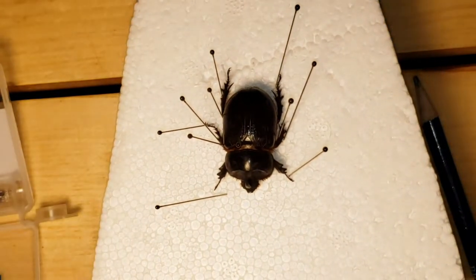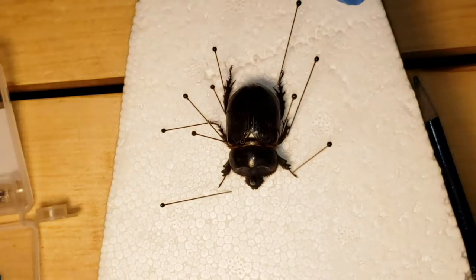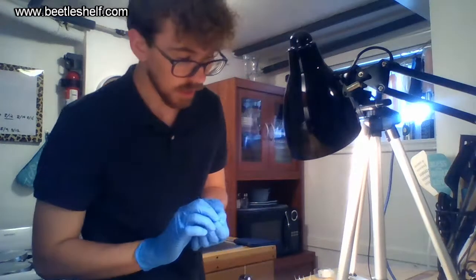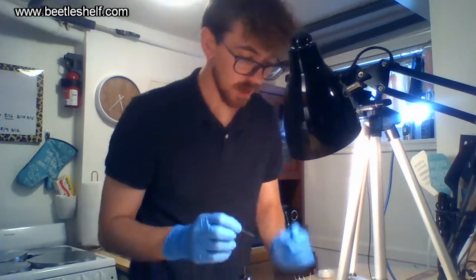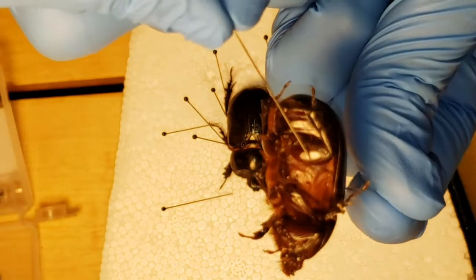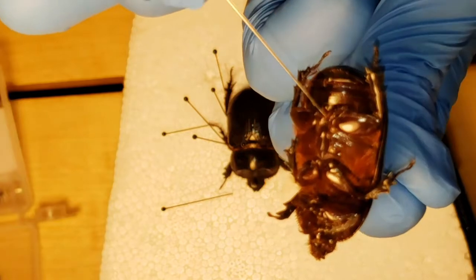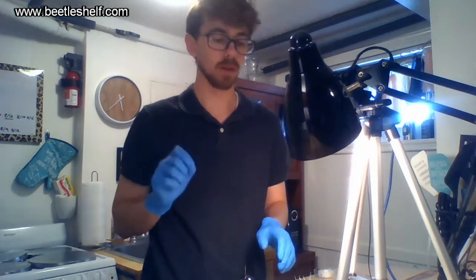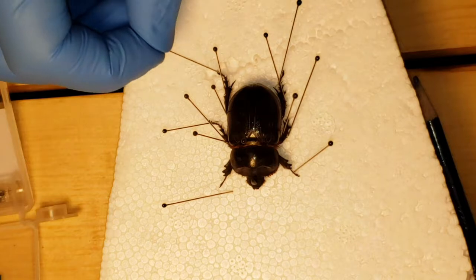The rest of the pins are just holding the insect in place. What I usually do is put about three pins on every leg, depending on how easily it's coming together — one to hold the upper section of the leg in place, another to hold the longer middle section, and one to hold the tarsi, the very claws. This beetle is very wide, so it's harder to reach the thicker part of the leg since it's usually mostly underneath. Two pins might be sufficient for most legs.